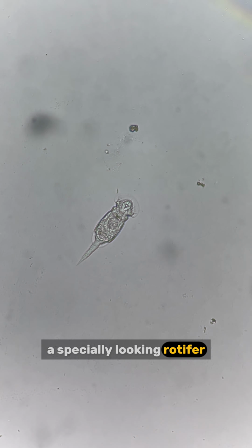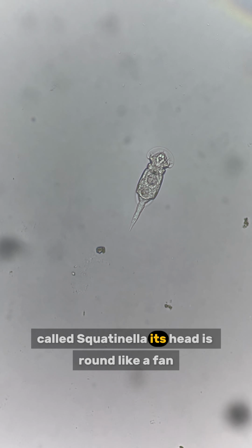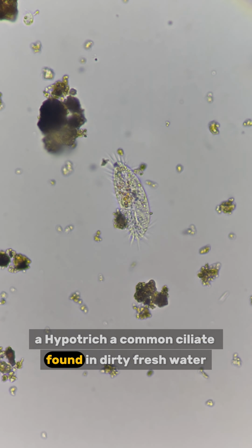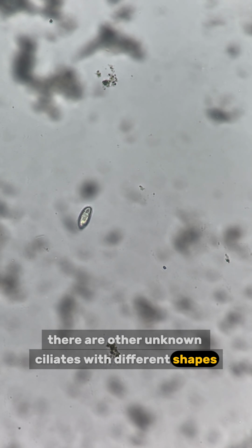A special-looking rotifer. It is a species we have never seen before, called Squatinella. Its head is round like a fan. A hypotrich, a common ciliate found in dirty fresh water. And also, there are other unknown ciliates with different shapes.